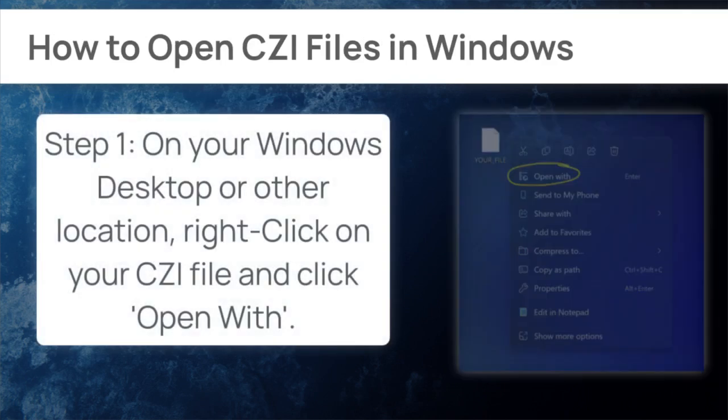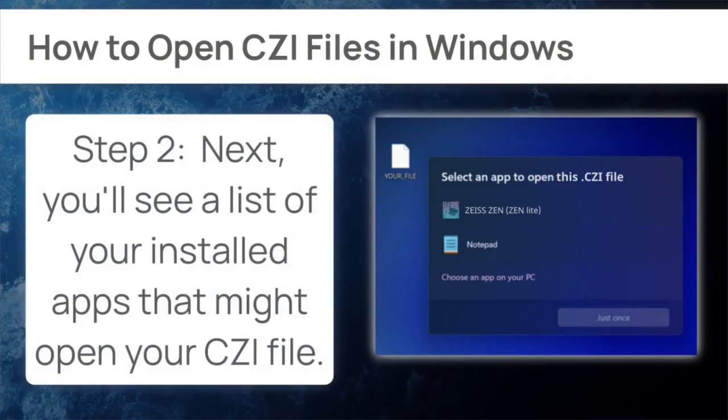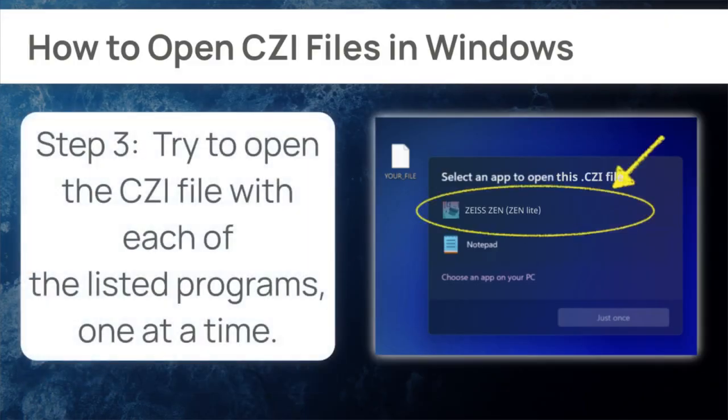Open the menu by right-clicking your CZI file and choosing Open with Zen Lite first if it is visible. If not, select another application. Different tools have different strengths with specific formats.